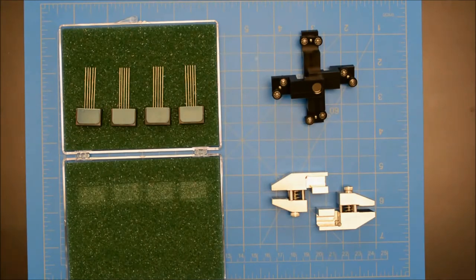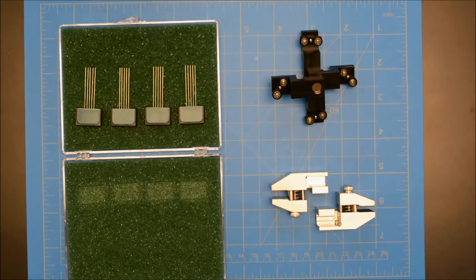For arteries in general, shear is quite small when the test axes are aligned with the longitudinal and circumferential directions of the artery. This gives us an opportunity to use the rakes. This system is designed by Cellscale and allows for easy specimen attachment.